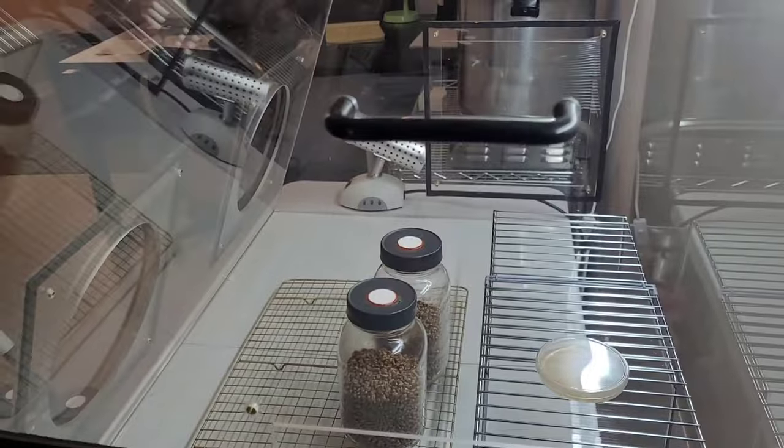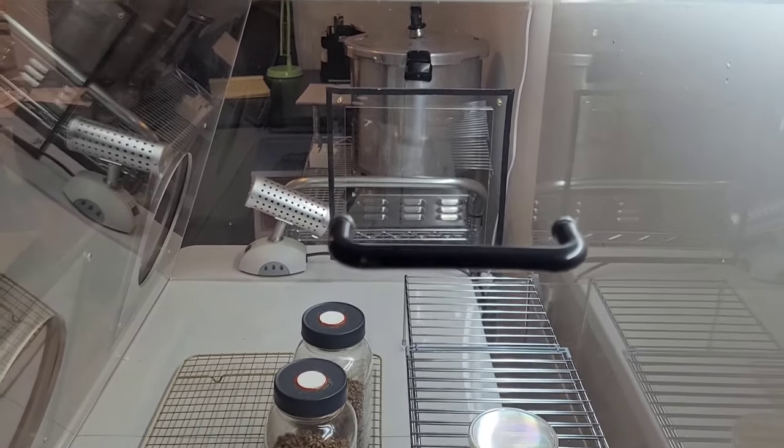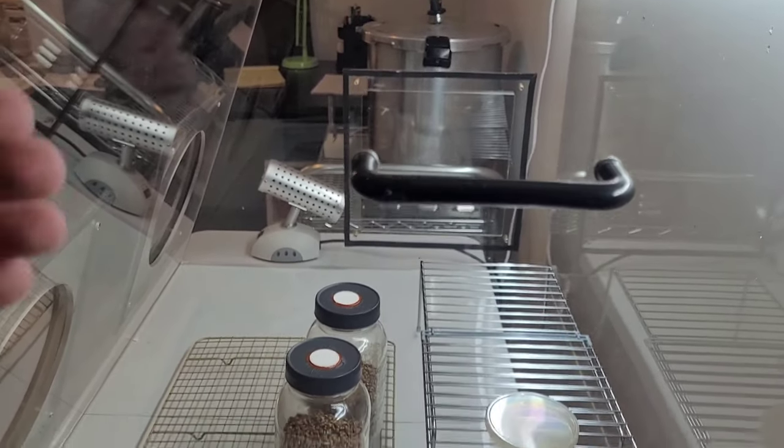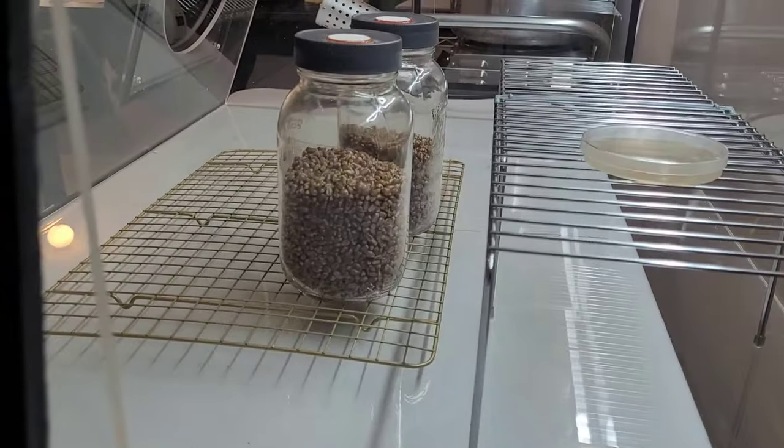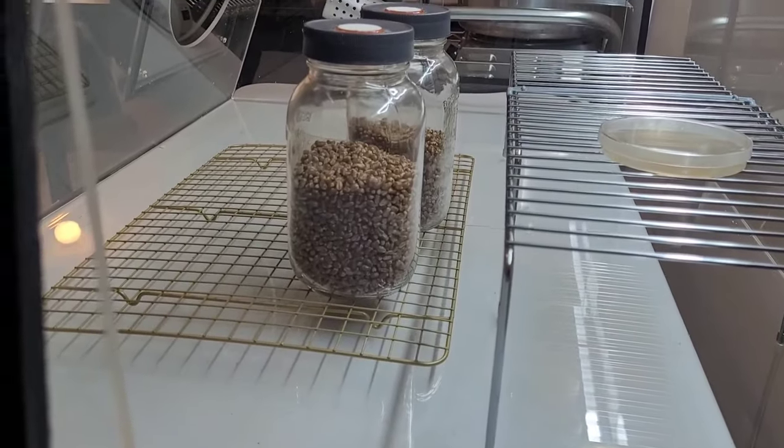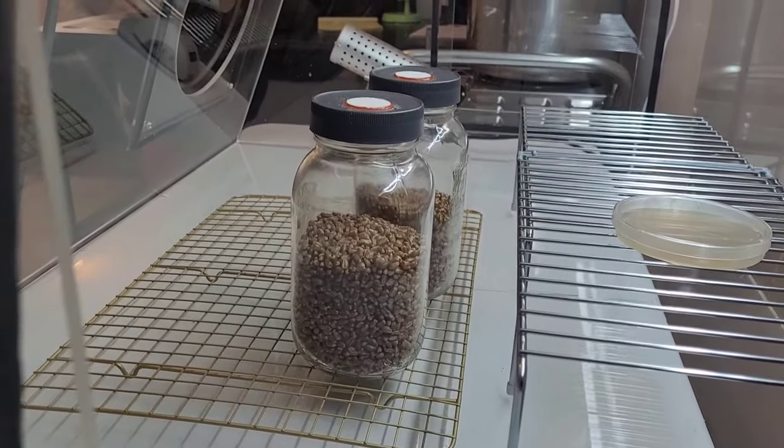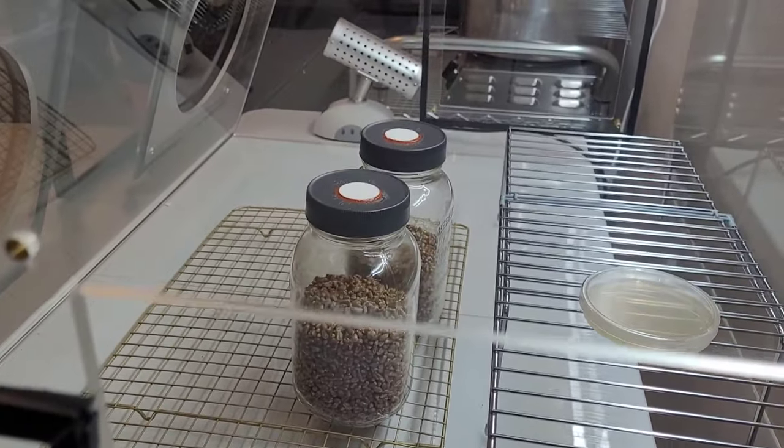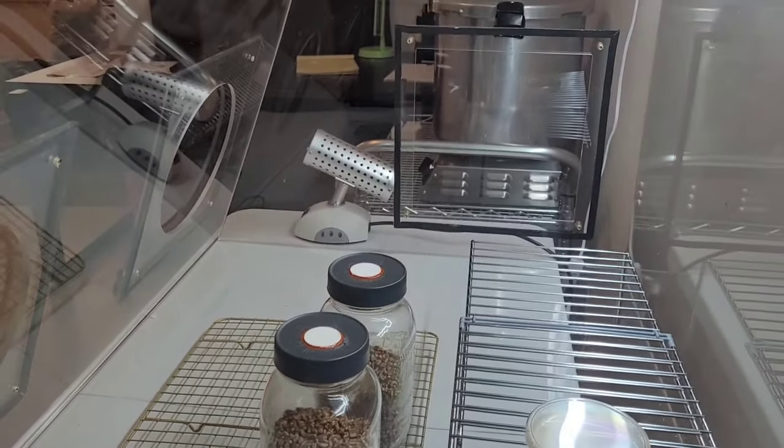Now not only is this box still, but it remains still in order to allow airborne particles to settle via gravity on the floor of the still air box. And if you're placing your work directly on the floor and moving them around, essentially you're just kicking up invisible dust clouds of all sorts of nasty mold spores, pollen, or whatever else you have floating around in here.